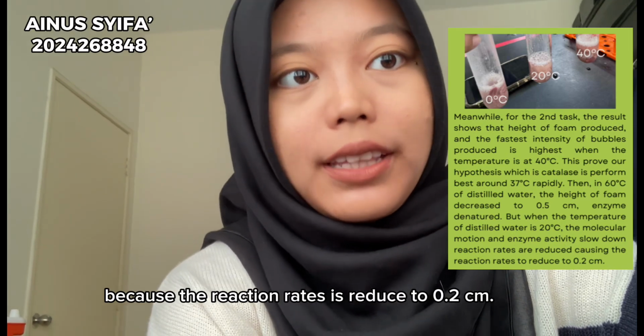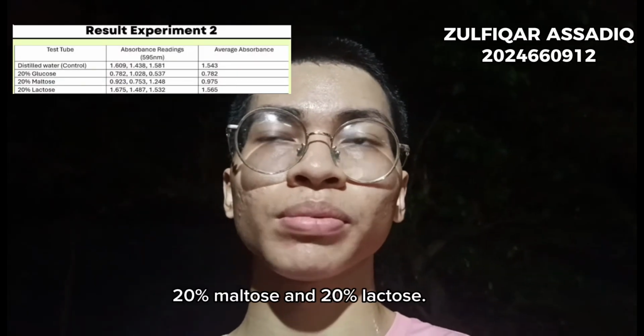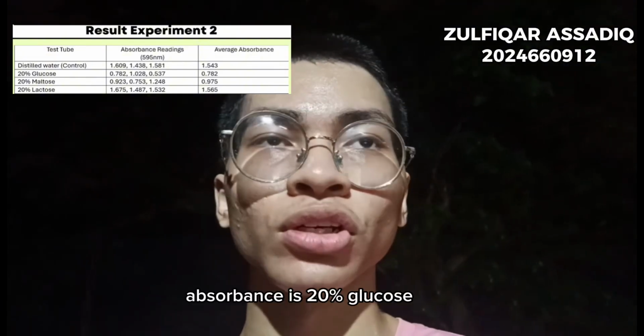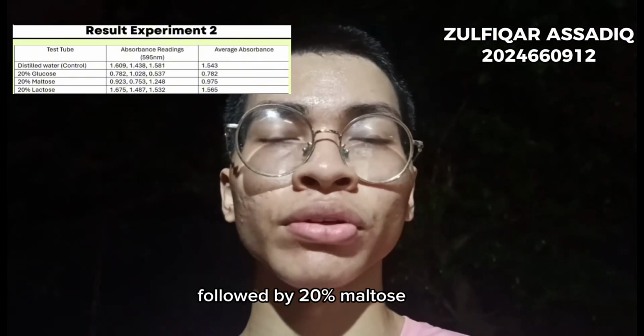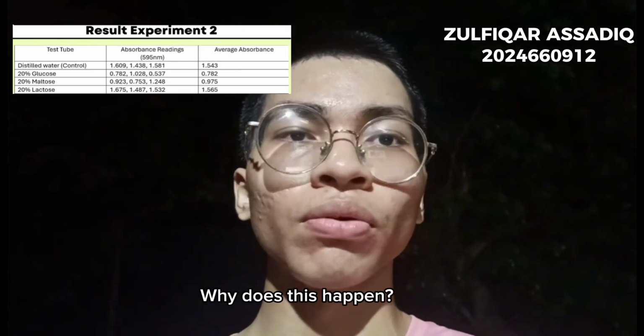We have 4 test tubes, which is distilled water, 20% glucose, 20% maltose and 20% lactose. And for the lowest average absorbance is 20% glucose followed by 20% maltose and then followed by distilled water and 20% lactose. Why does this happen?